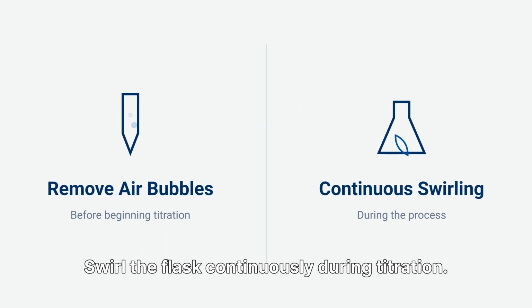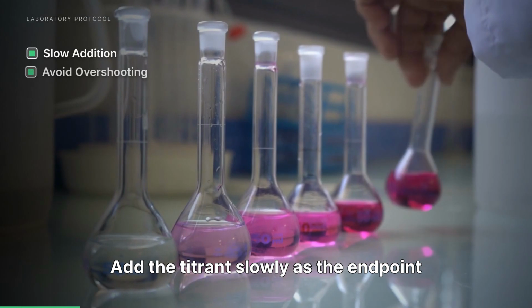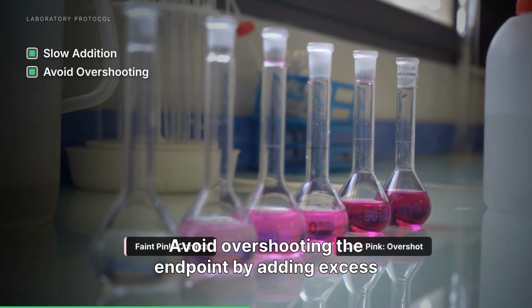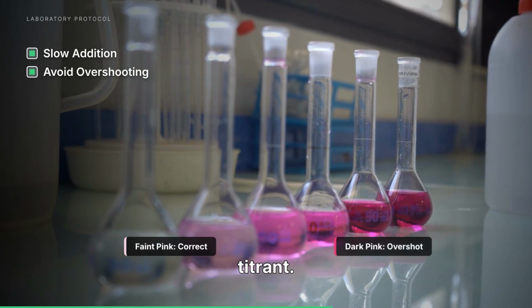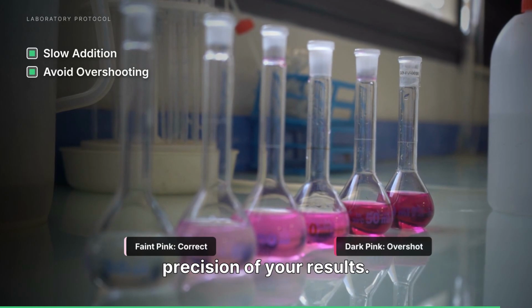Swirl the flask continuously during titration. Add the titrant slowly as the endpoint approaches. Avoid overshooting the endpoint by adding excess titrant. These practices improve both the accuracy and precision of your results.